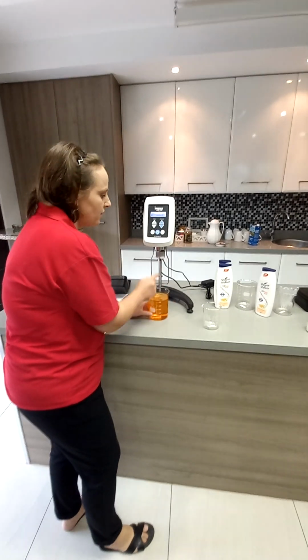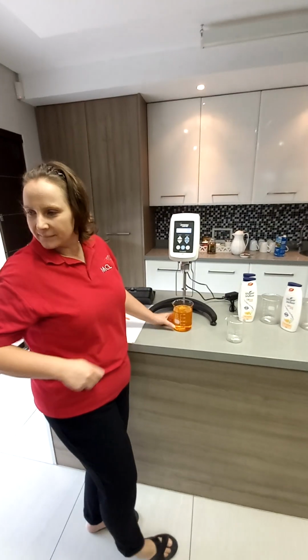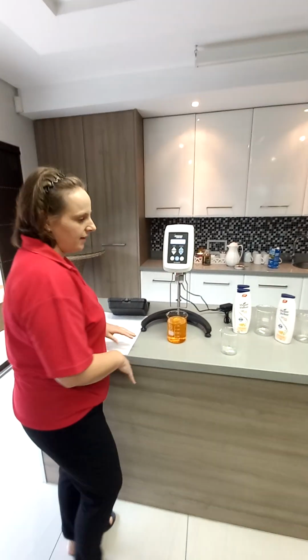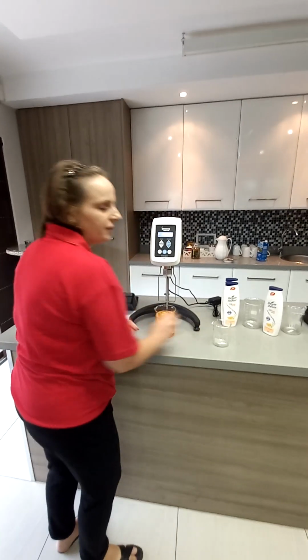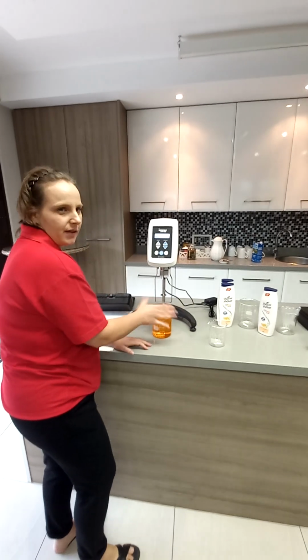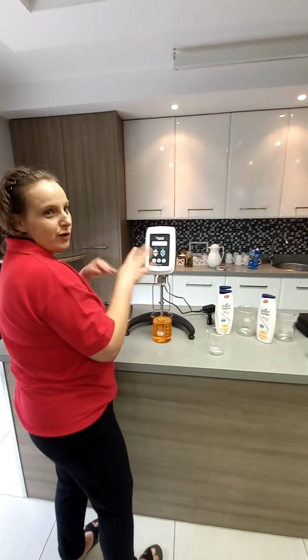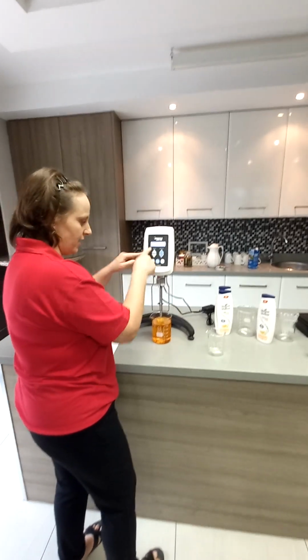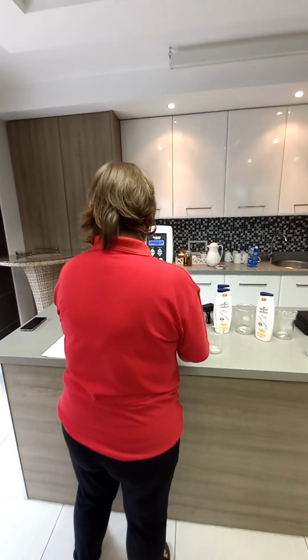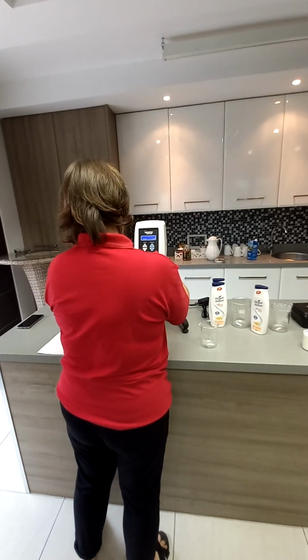Because if you bump the spindle, you're going to hurt the internal. But if you're testing, you always test without the guard. And if you set up your spec with a 250 ml beaker, you must always test with a 250 ml beaker, because it takes into account the diameter. The unit's viscosity calculation is programmed with the diameter of the 600 ml. I'm going to take it off. So I'm very careful.